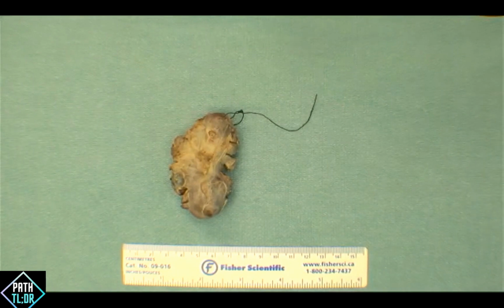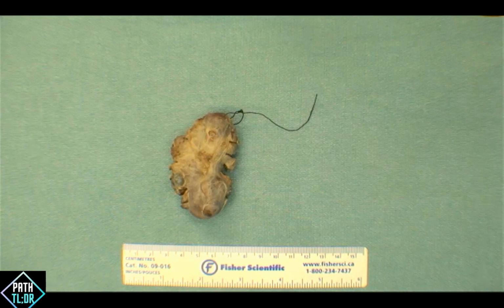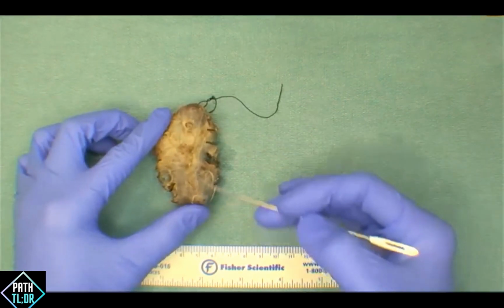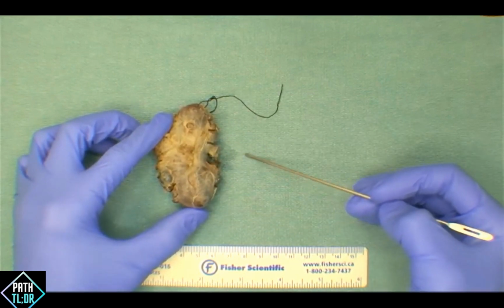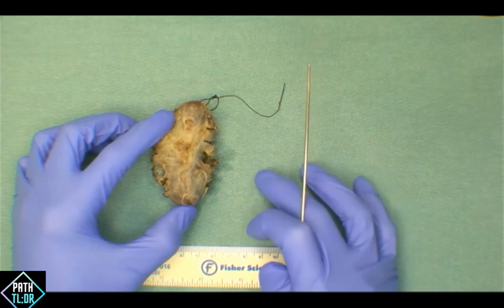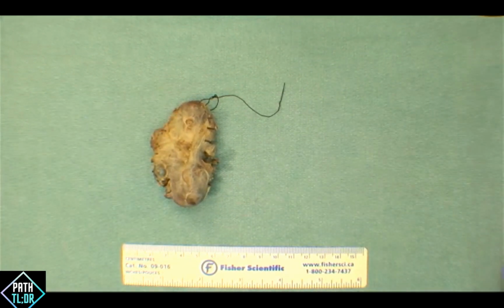What we're going to talk about today are indeed some thyroids, and we're going to look at the different types of thyroid resections. Just take a step back and think about some anatomy. The thyroid gland can be found within your neck, and it sits just below the larynx on the tracheal surface. Most thyroid glands, if you have the total thyroid, is a butterfly-shaped organ, and it has either this H configuration or like a U-shaped configuration, depending on the nature of the resection and the nature of the thyroid gland itself. And so what we can see here is we really only have one side of the thyroid. This would have a bridging isthmus coming across, and then a second lobe that would come around on the other side. And I'll show you a nice example of it in a little bit.